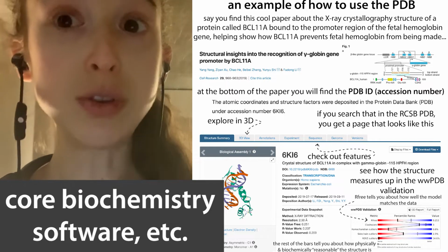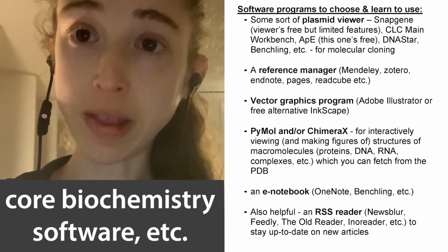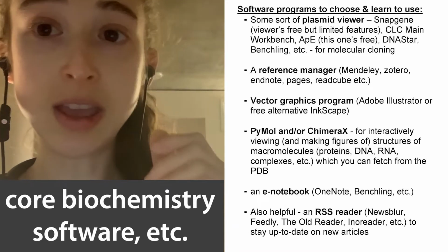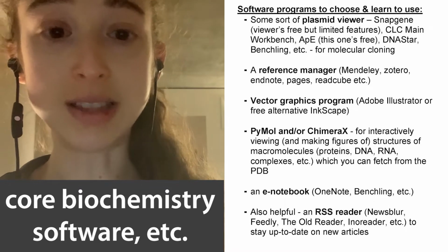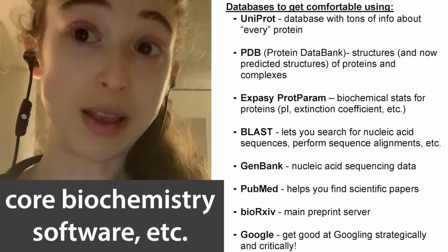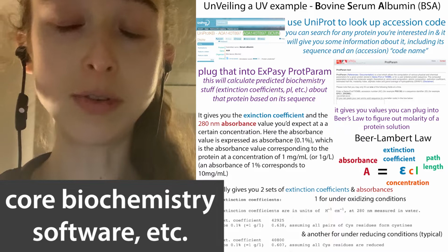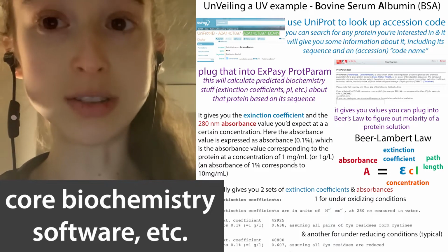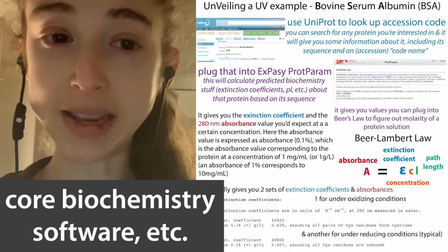If you want to then view those proteins, you can use a structure viewer like ChimeraX or PyMOL. These are really great for allowing you to interactively work with these 3D protein models and then make really pretty figures. If you want to figure out more about the makeup of the protein, there's this tool called Expasy ProtParam that's really helpful for finding things like the extinction coefficient, which is going to allow you to figure out the concentration of a pure protein based on its absorbance of UV light.